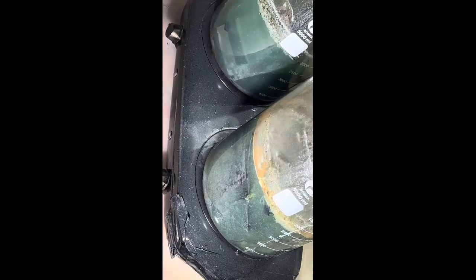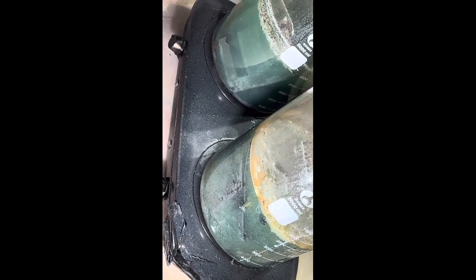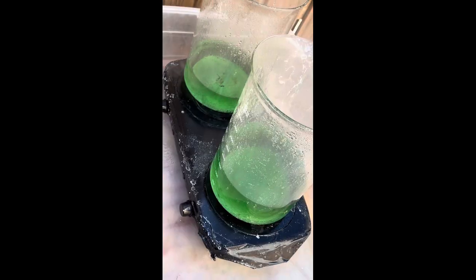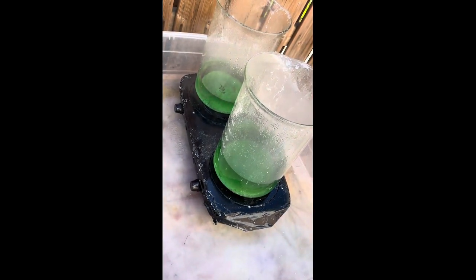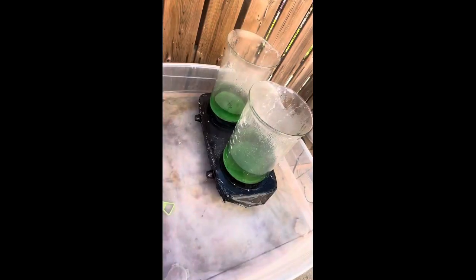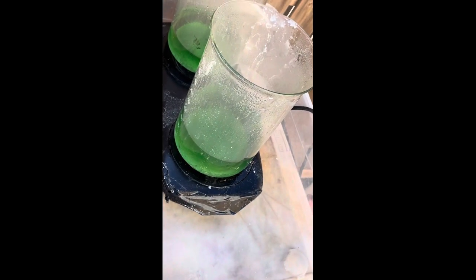Now I'm turning the heat down — the solution looks very saturated. I think those bubbles are just from boiling, not from the acid reaction. I'll let the temperature go down, then filter it and wait until tomorrow to see if I get any crystals. Before filtration I added water to make filtering quicker, but I found out that adding water prevents crystal formation, so I only got a small amount of crystals. I'm trying to decant a little more to get more.